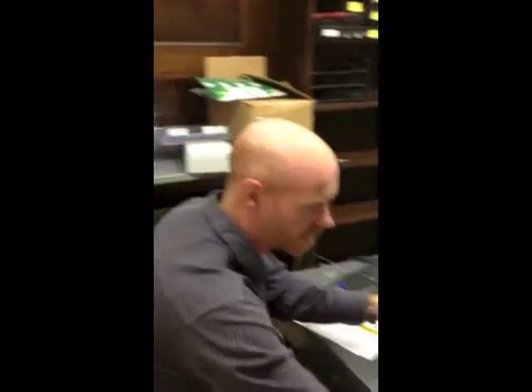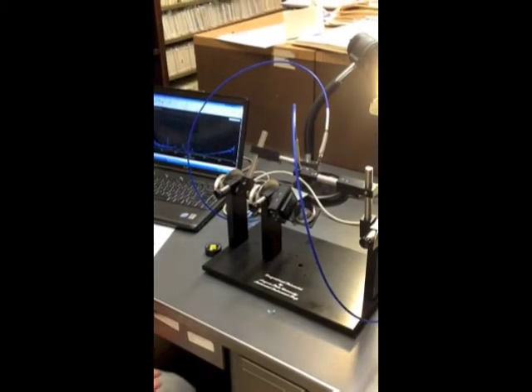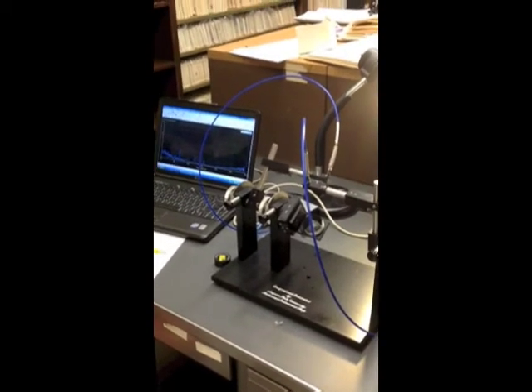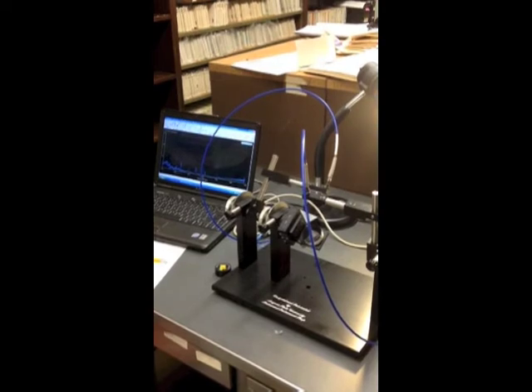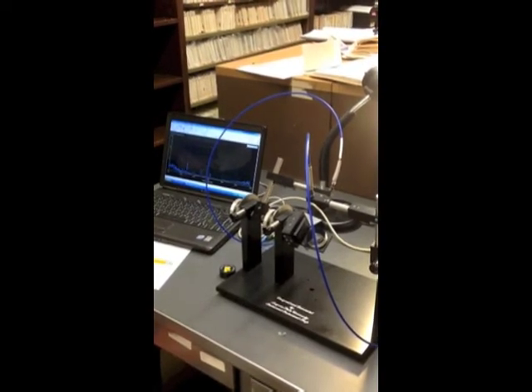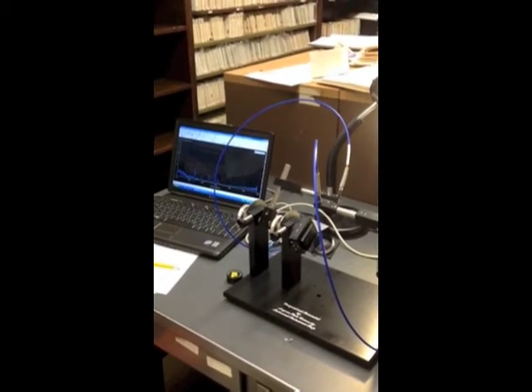And if we change the angle between the spectrophotometer and the light by moving only one of the arms, now we're getting diffuse reflectance, which is not that nice shiny color. It's more what we see from the edges. Interesting. So all of this is reflected light as opposed to transmitted? Absolutely, yeah. In this case, we're only measuring reflectance.